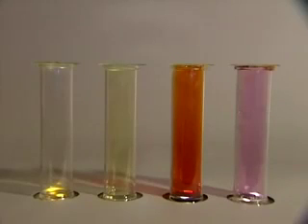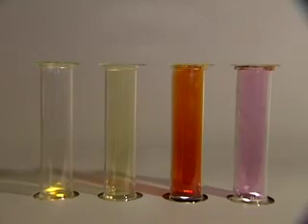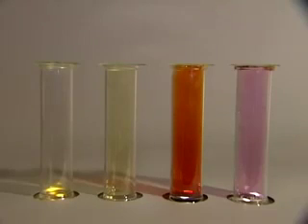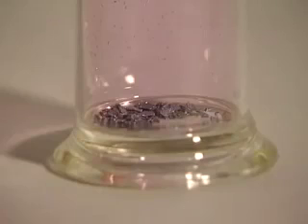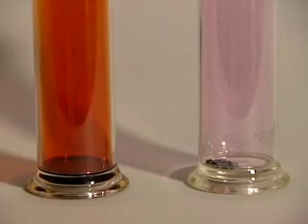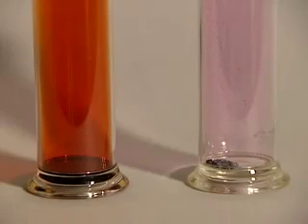Here are the four halogen elements: fluorine, chlorine, bromine and iodine. Fluorine on the left is almost colourless. Next comes chlorine which is greenish yellow. Fluorine and chlorine are both gases at room temperature, but bromine is a liquid and iodine is a solid. Even so, they're both quite volatile. You can see the coloured vapours — orange-red above the liquid bromine and purple above the solid iodine.